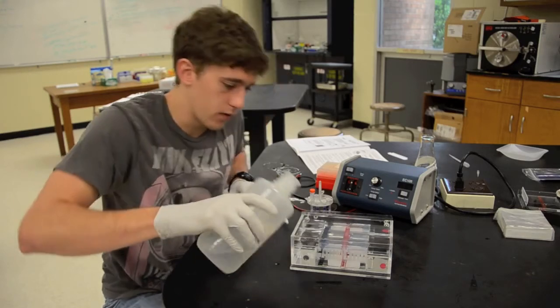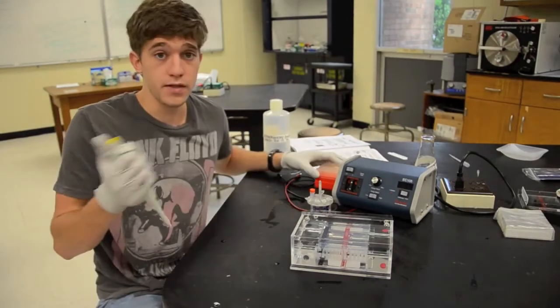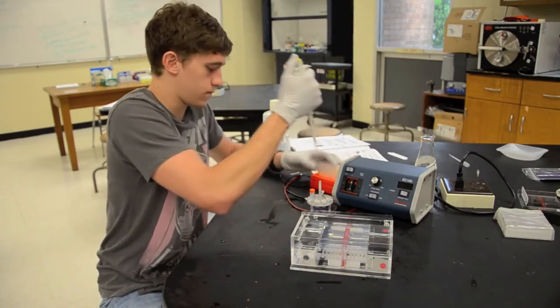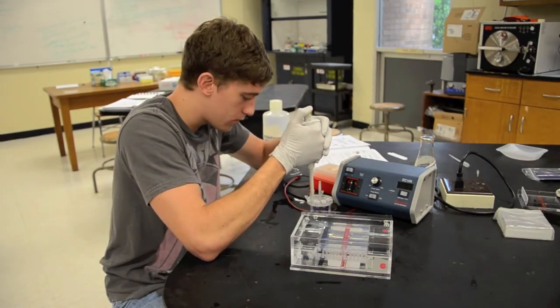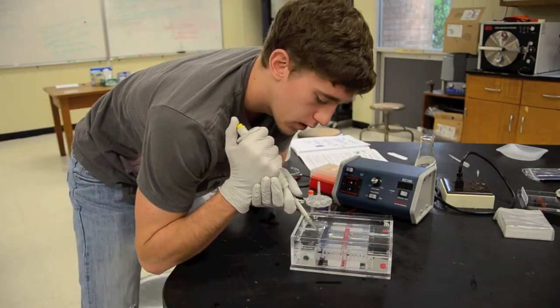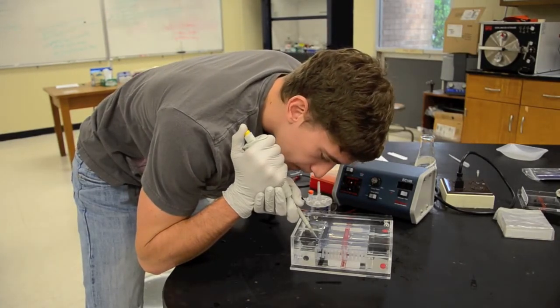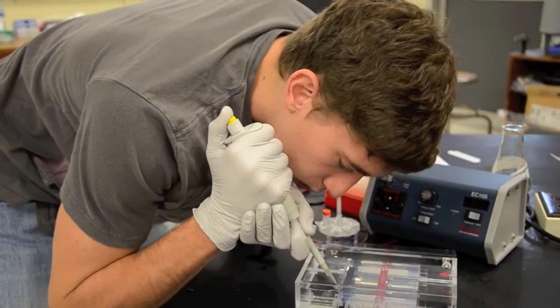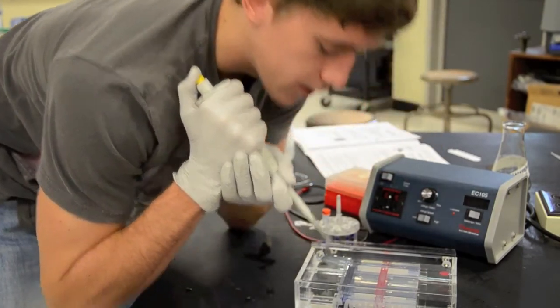Okay now that we've added the buffer it's time to once again load our samples and do this in the same manner using a clean pipette tip of course. Carefully going right over the well being careful not to actually make contact with it, you want to dispense the liquid right into the well. And there you have it.